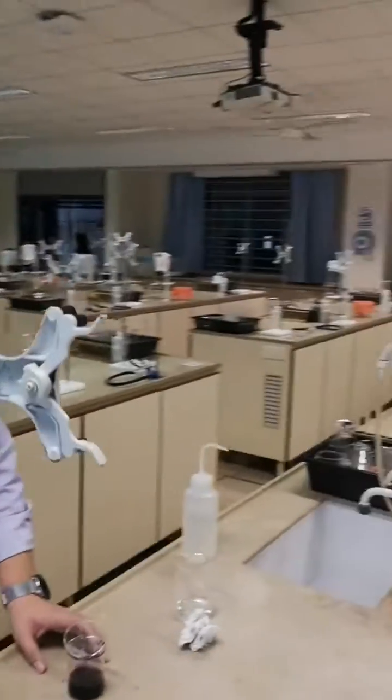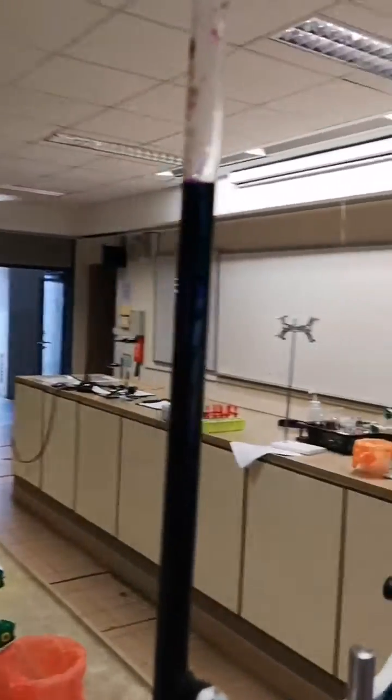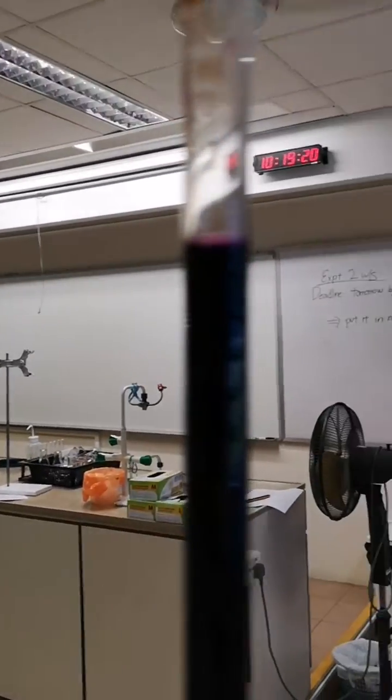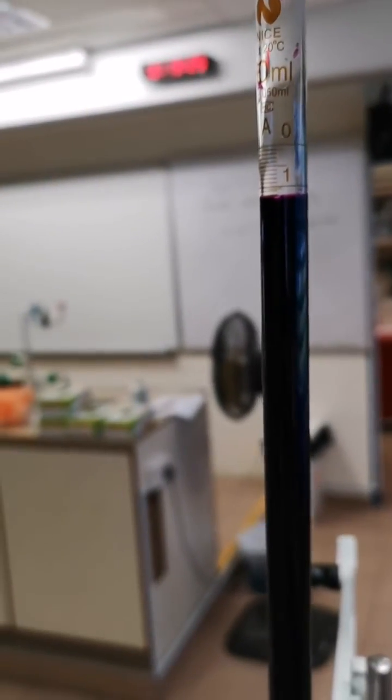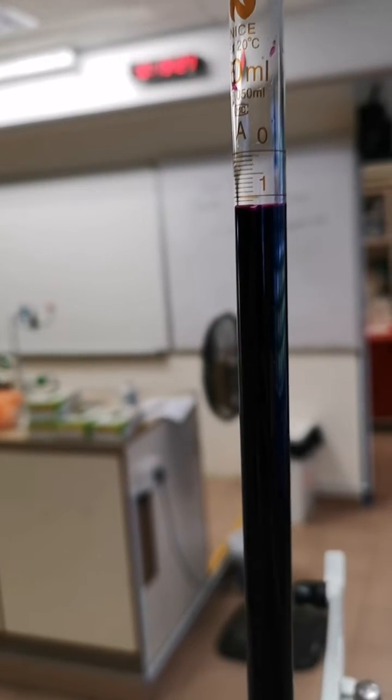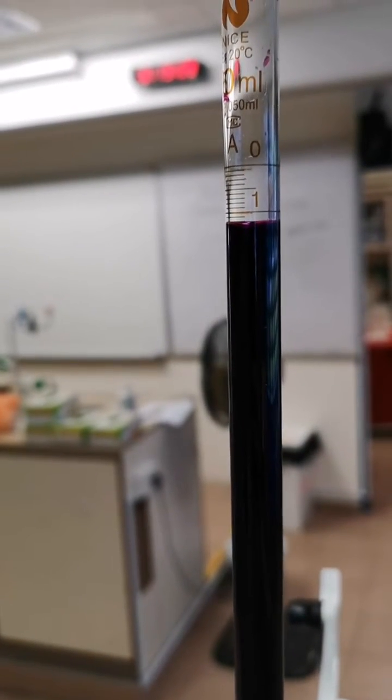Following the procedure, we have filled up the burette with KMnO4. Please take note that it is not necessary to fill up to the zero mark. As long as you have recorded your initial reading of your burette, you may start at any point in the burette.